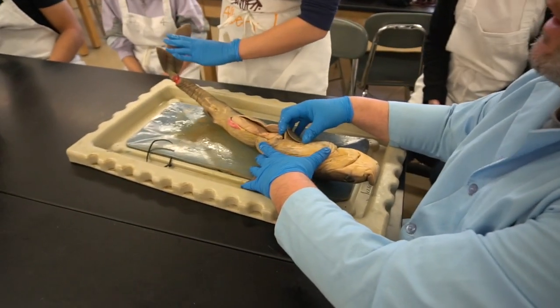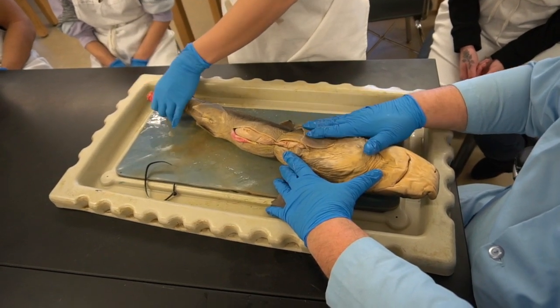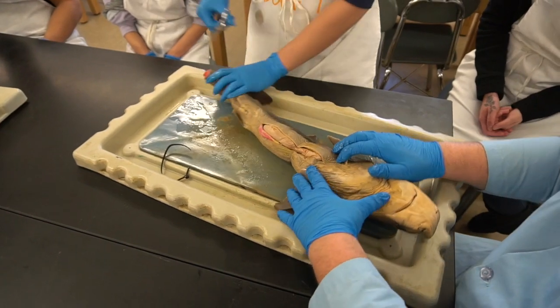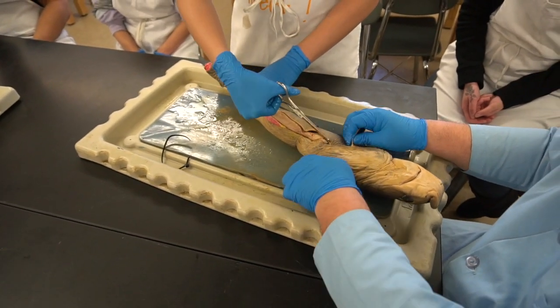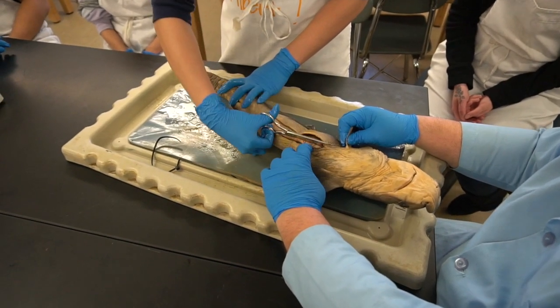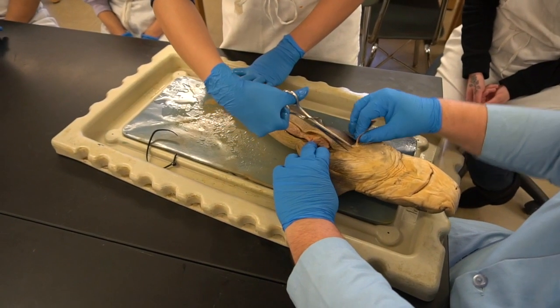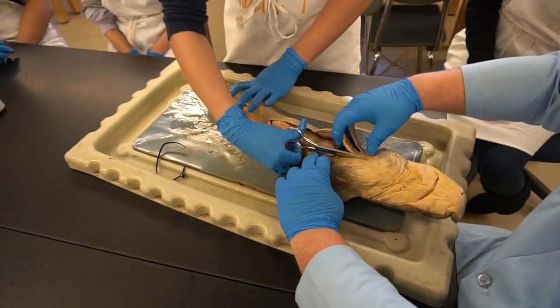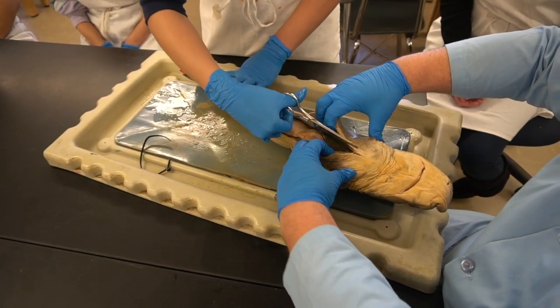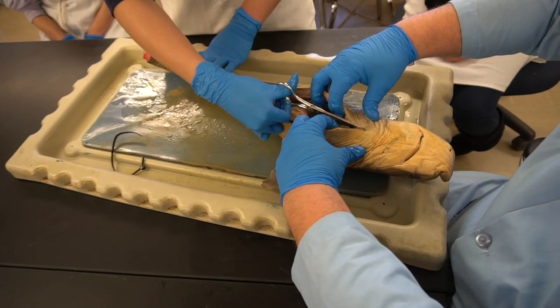So to do this, it's best done by two operators. One person should be towards the head of the animal, and if you want to start towards the anterior, just hold the animal in a position where it's available. Remember, as always, we want to insert our scissors into the opening and cut upwards, only cutting the body wall, not cutting any organs inside. The secondary person can then, as the cutting is going, put your fingers inside the body wall and put a little gentle pressure outwards. It makes the cut very much easier.